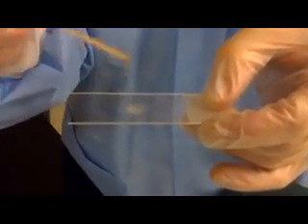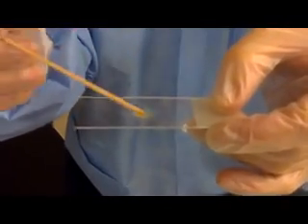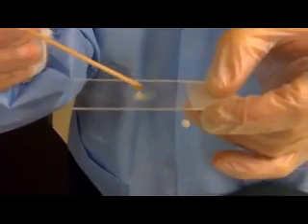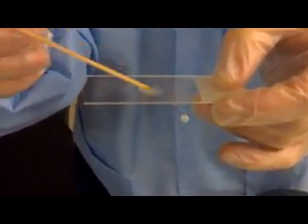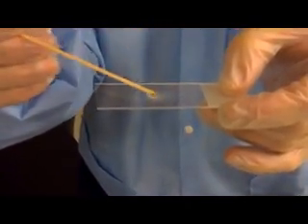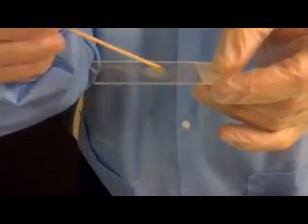It's starting to string very well now. So we have confirmed with the KOH test that we have a gram-negative organism here from the string that you see.